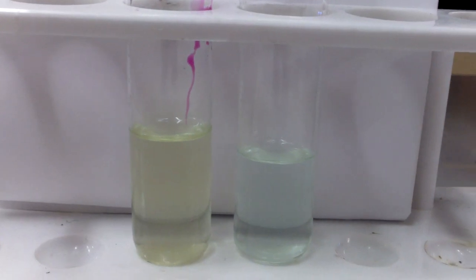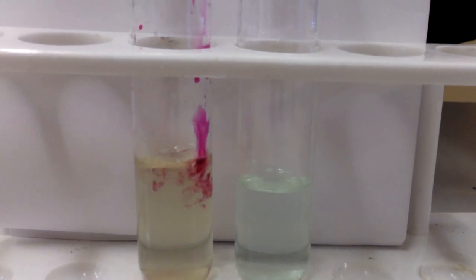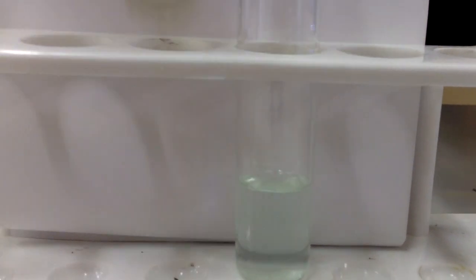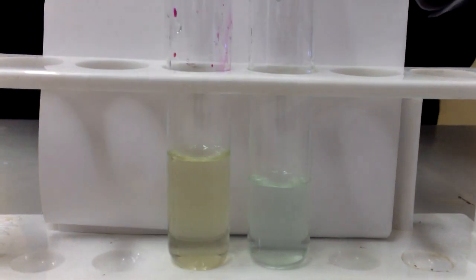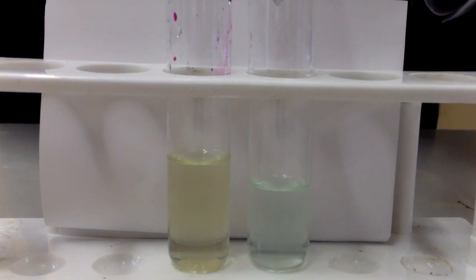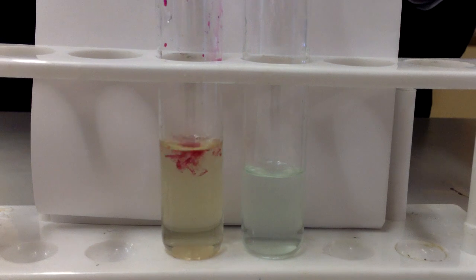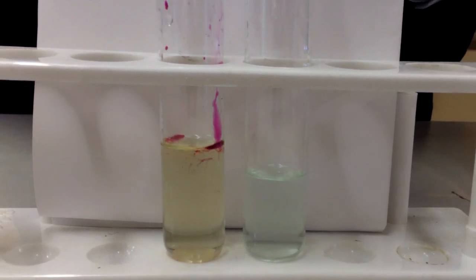The permanganate, being the oxidizing agent, is itself reduced in this chemical reaction. The reduced form of permanganate is the manganese ion, Mn2+, which is colourless. So any change in colour that we see is due to the Fe3 ions being produced, which are straw yellow in colour.